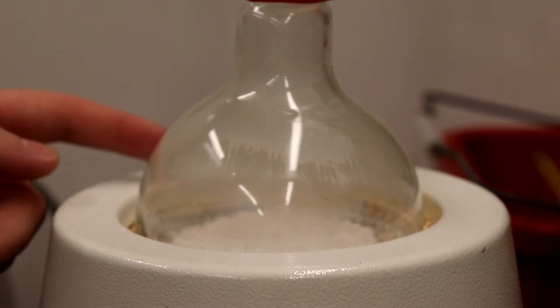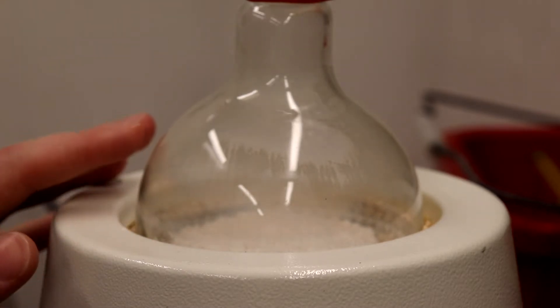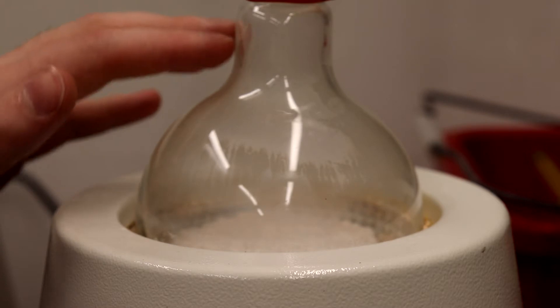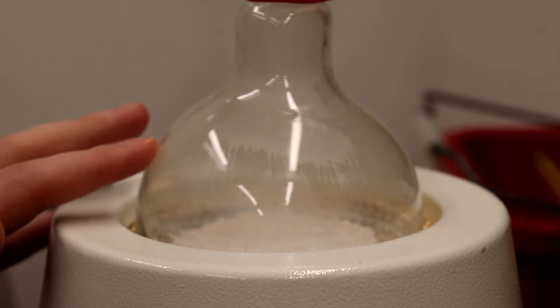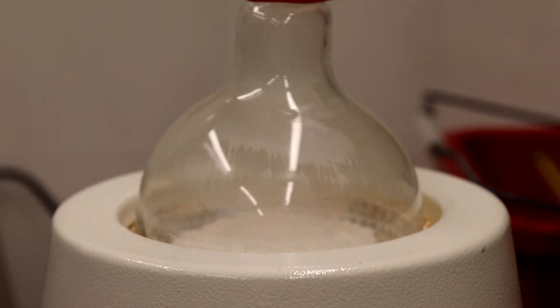I can see on the edges some of the PABA is starting to melt, and you can see that I can actually see some little droplets forming on the sides of the flask, and that would be your aniline already forming.